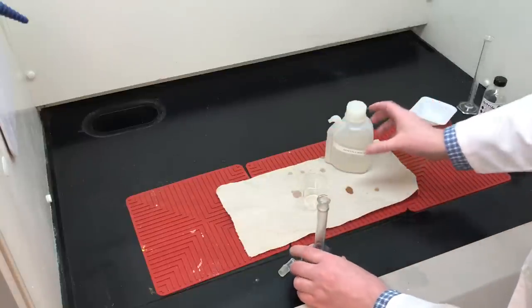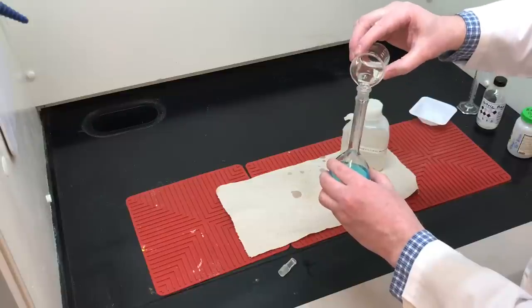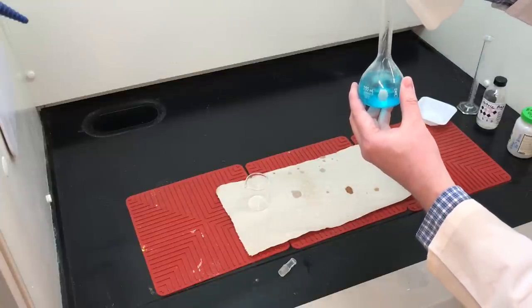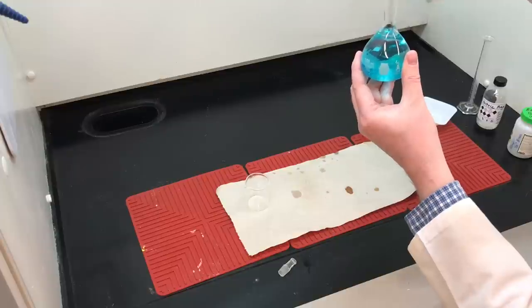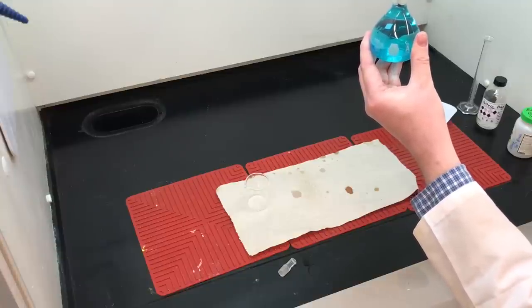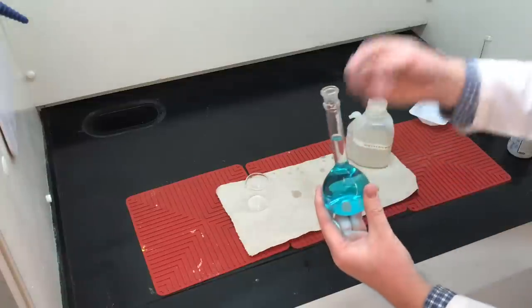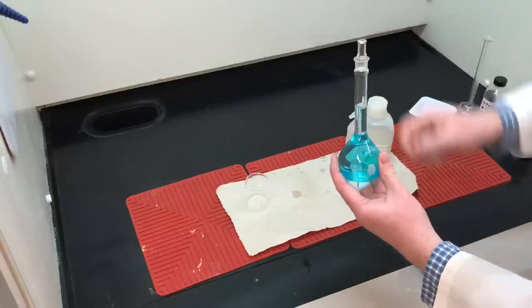Recall that brass is an alloy of copper and zinc. Now that I've got all of the dissolved brass into the 100 milliliter volumetric flask, I can add distilled water until the meniscus is just touching the line on the neck of the flask. Normally you'd stop just below the line and use a plastic pipette, but I'm going to add drop by drop. You have to be looking at eye level when doing this.